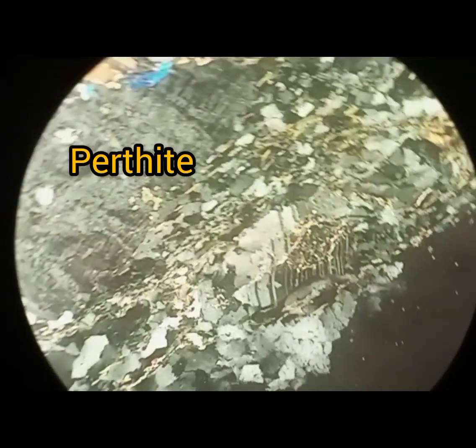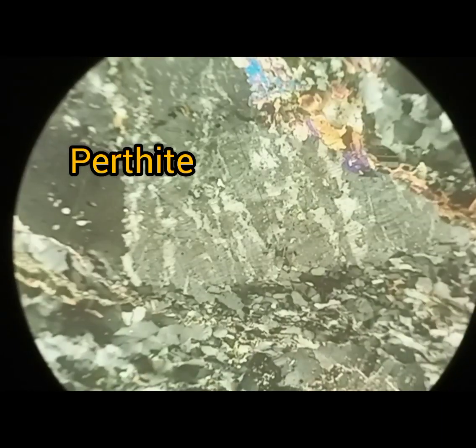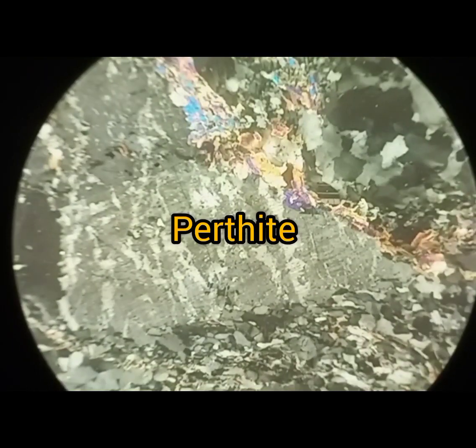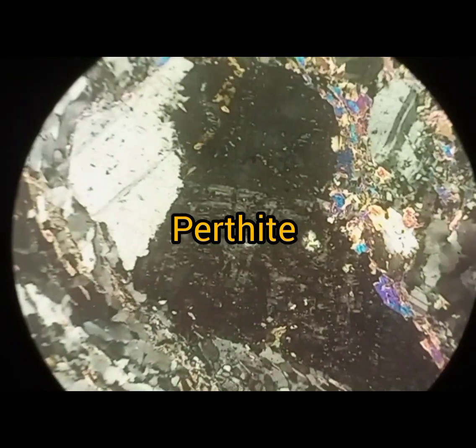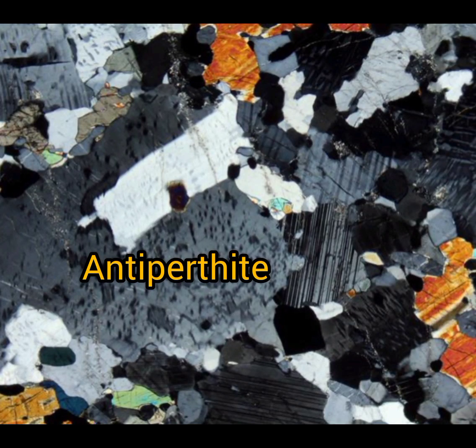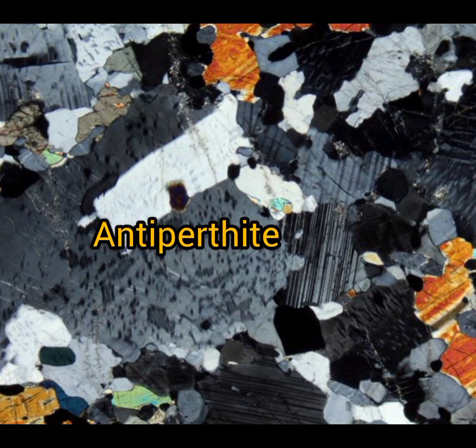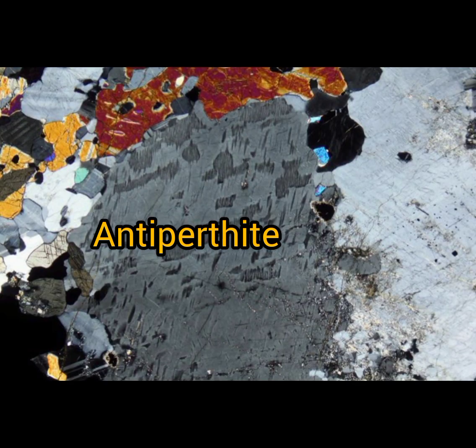We also call that orthoclase. On the other hand, if sodic feldspar is the dominant phase and contains potassium feldspar lamellae, that is known as anti-perthite.